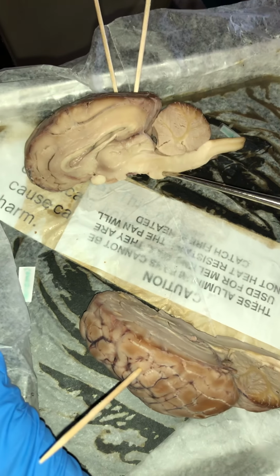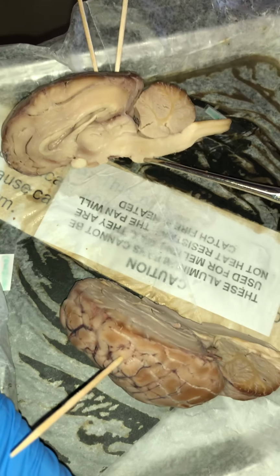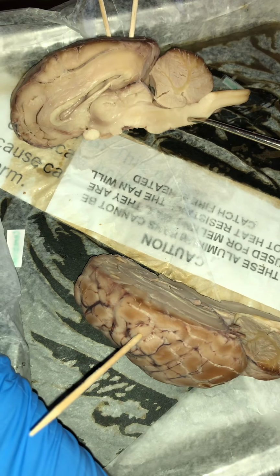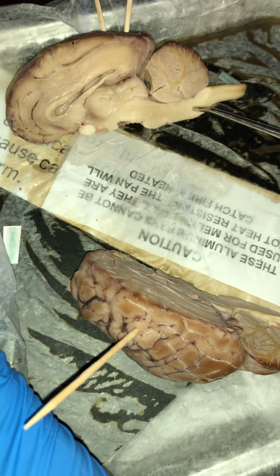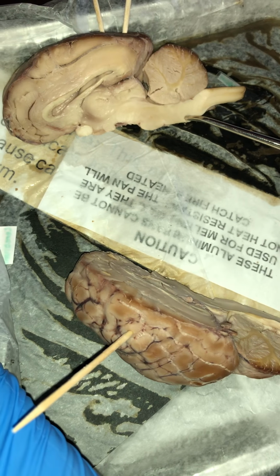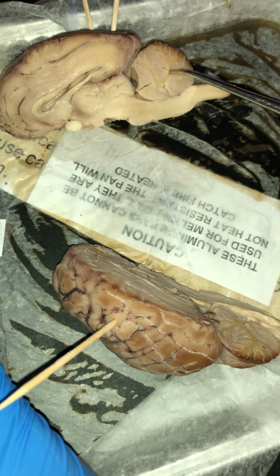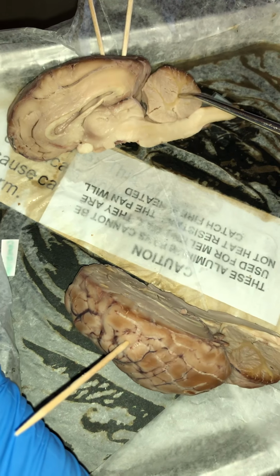The pons is this area right here. The pons connects the cerebellum to the nervous system. Going on from there, we have what is known as the medulla oblongata. The medulla oblongata, which is on this area here, helps maintain blood pressure and heart rate to make sure that they're normal. Going on from there, we have what is known as the arbor vitae, which is this white area here, which provides necessary sensory information to the brain, as you can see here.